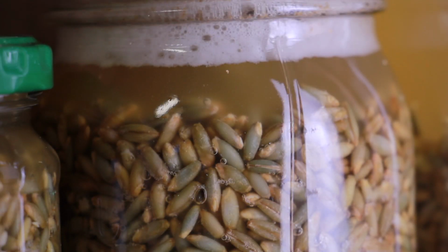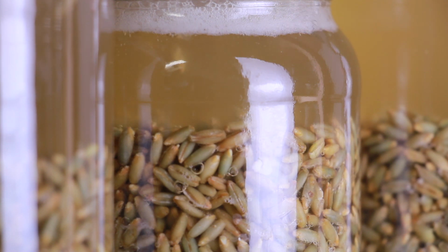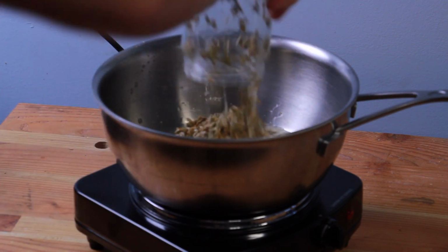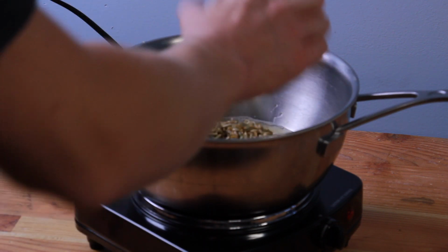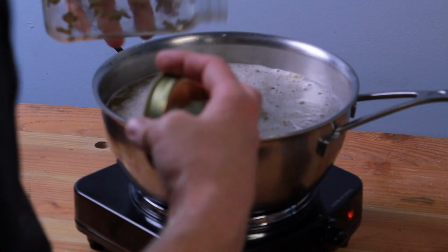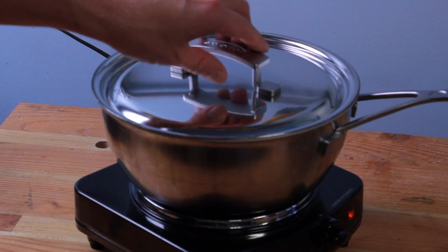You can see that there's already a lot of activity from any germinated spores or bacteria that are in there, producing gases and causing some stirring action of the grain bed. I dumped all the jars into my pot and heated them up to a boil, then reduced the heat to keep it just at a low simmer, and I boiled them for about 10 minutes.